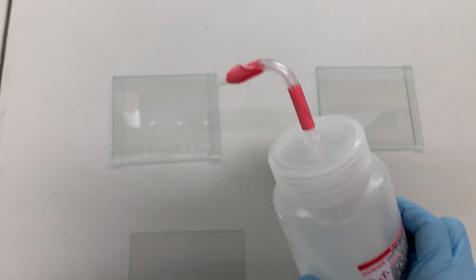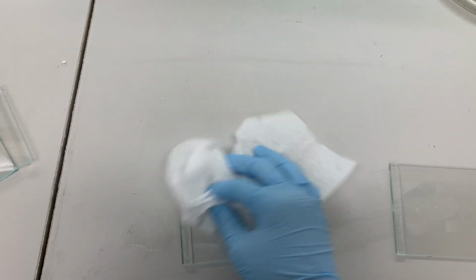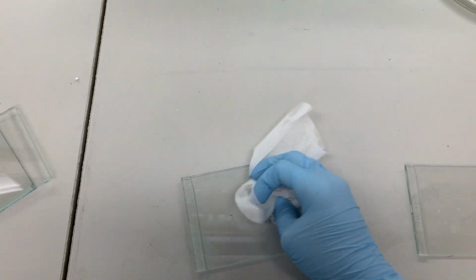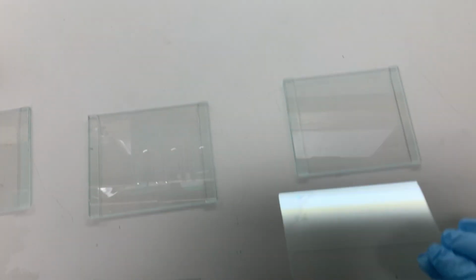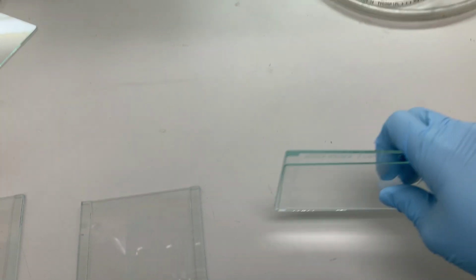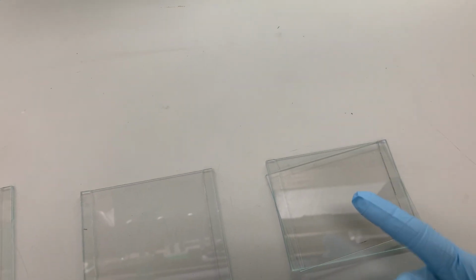I line up my plates and then I squirt some 70% ethanol, and then I come and clean them, and it makes nice squeaky noises. I do that for all of these, and then I let them air dry. I like to line them up like this, so I can just flip directly over and stick it in the tray. Make sure you put the sides that you cleaned together.